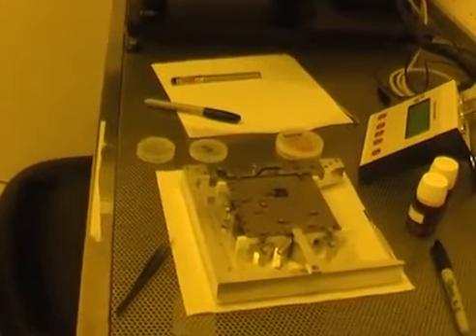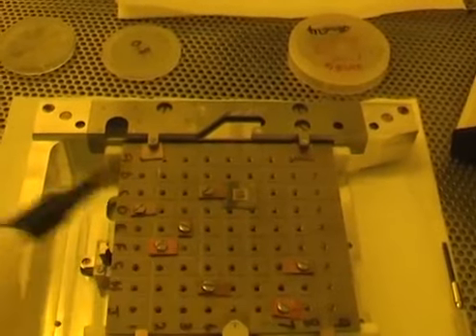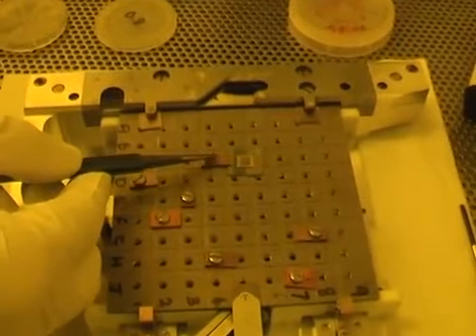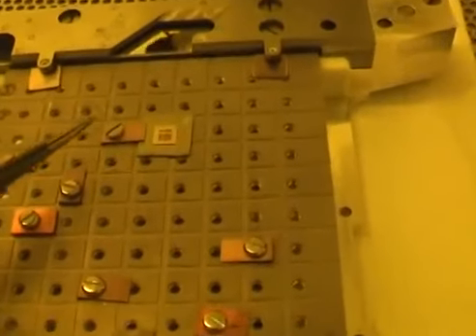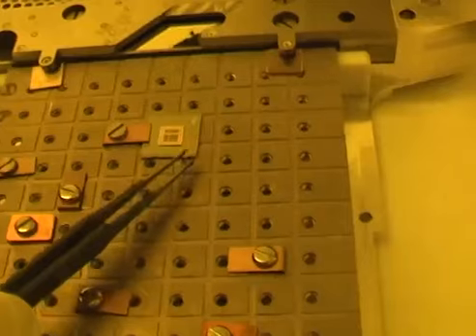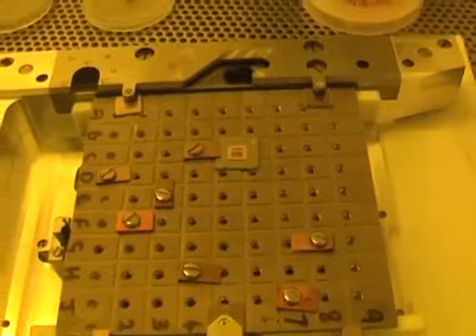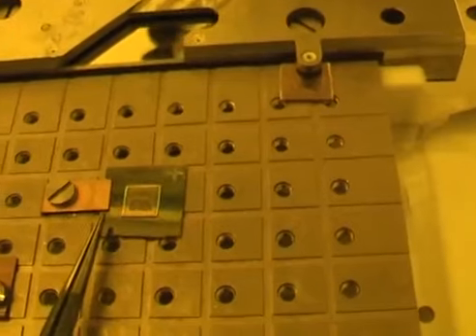Now, if you remember what I said earlier, I was pushing it here and said I could detect a small amount of motion. And actually, all the error is in that direction, which suggests it might be the clamping here that's causing the problem. There's two ways around that. One is to clamp more securely by increasing the amount of sample under the clamp. And the second one is to put a second clamp up here to hold it down at this end. Because the bit that's going to be written on is this small chip in the middle here, I've got a millimeter or so extra I can clamp, so that's the first thing I'm going to try.